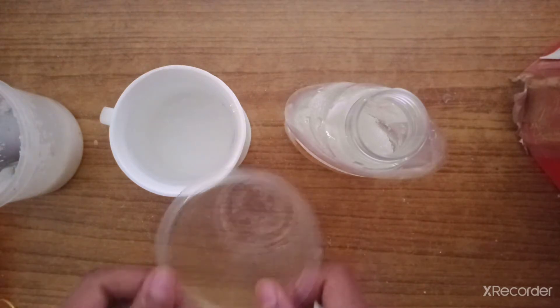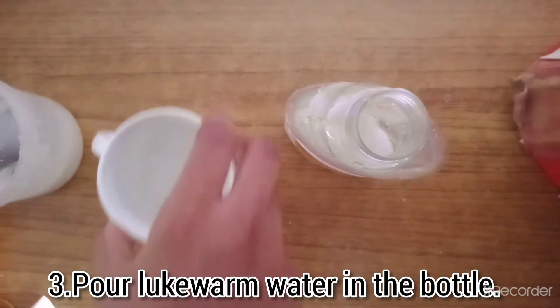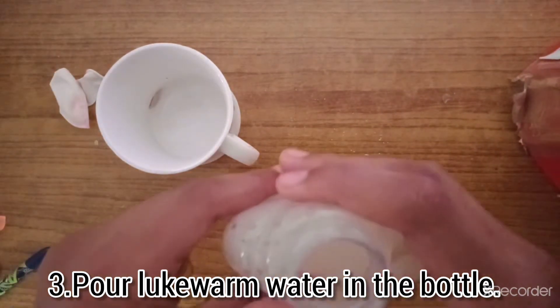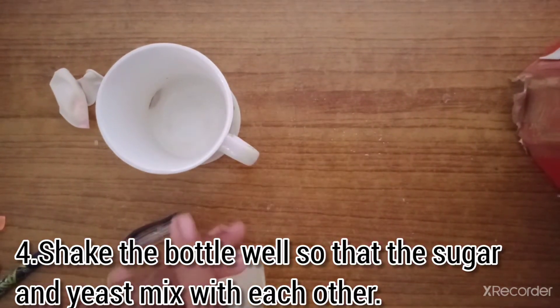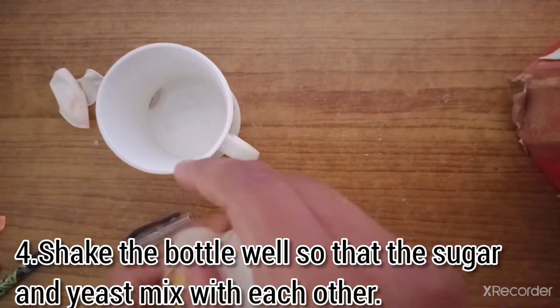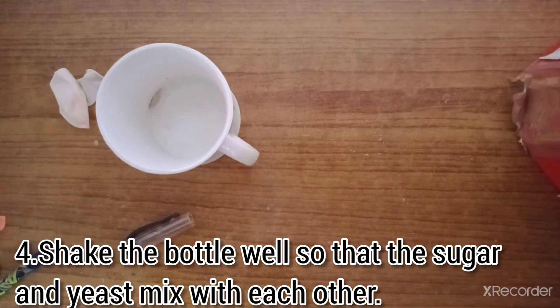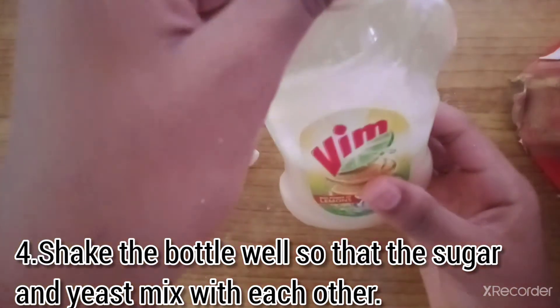The next step is to pour warm or lukewarm water into it. We have poured the warm water in. Now the remaining step is to shake it and then fix the balloon on it. I will shake it now.